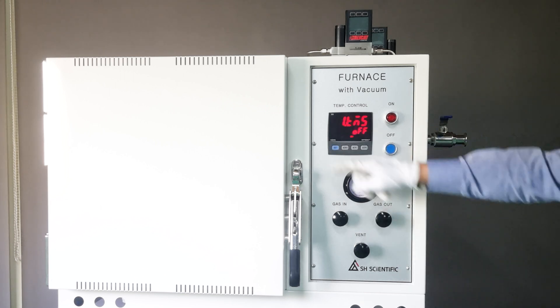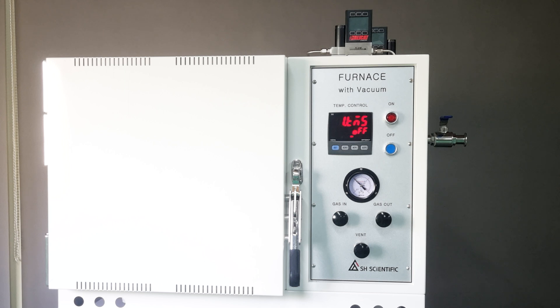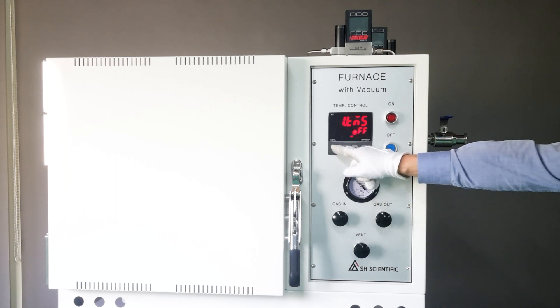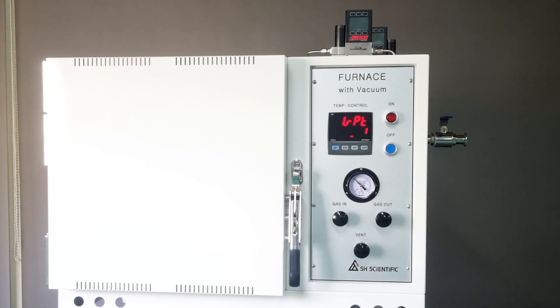To end the program, I'll enter 0 for 1SP5 and off for 1TM5, so the furnace will stop after step 4. Click the Set button to see 1RPT, which is the option to repeat all the preceding steps. I've set it to 1, which means no repeat. We recommend that you use 1 as well, just to avoid repeating the program unintentionally.